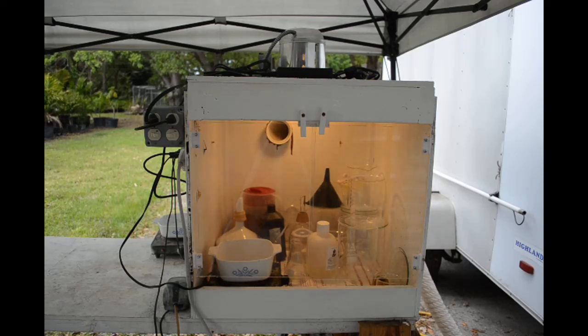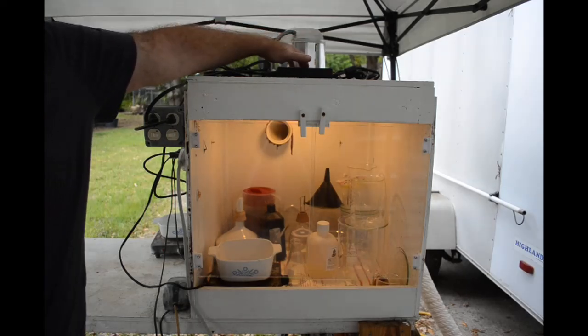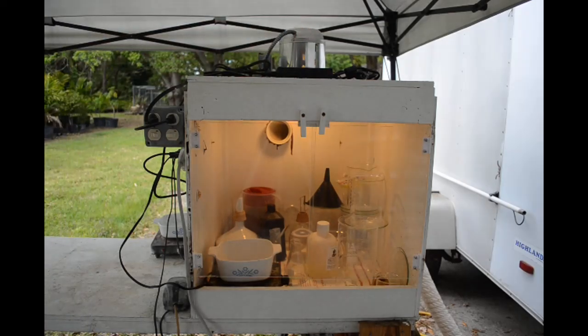So why is there a hole in the top of the fume hood? Well, if you go back and watch some of my early videos when I first built this fume hood, I had a bathroom vent fan up here, commonly known as a fart fan, up here and that was my original fan for ventilating the fumes.